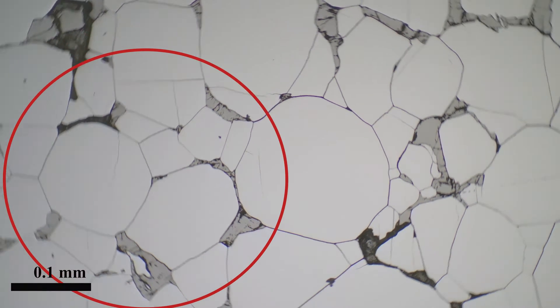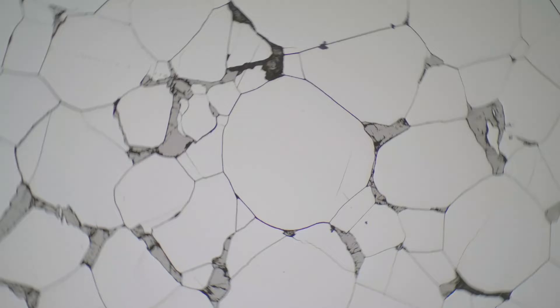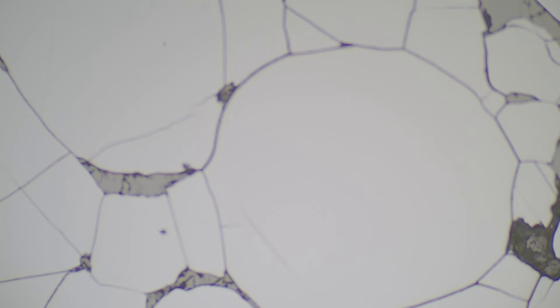We'll shortly switch and look at another similar sample. Here we are on the next sample — very similar looking crystals, still this gray color, sometimes it can be a little bit brown. We're not seeing any change as we rotate the stage because it's non-pleochroic. It's standing above some of the other minerals because it's a very hard mineral. When we switch into cross-polars we see that it's isotropic, so it's not reflecting any light. Sometimes there might be some internal reflections but we don't see that in our particular sample. We'll keep changing areas on the slide, zoom in a little bit, and we'll see very similar properties.